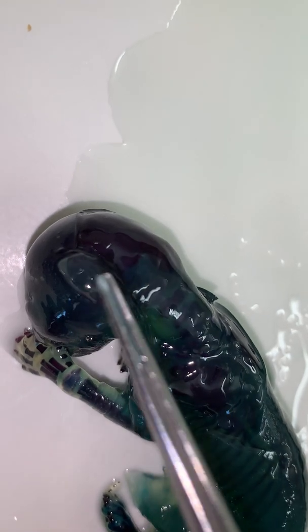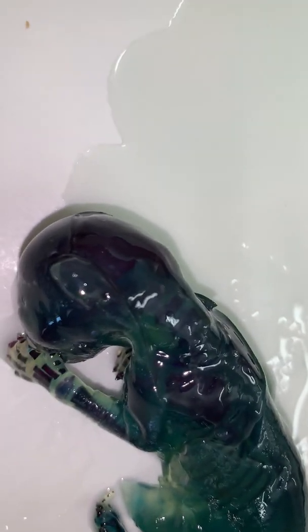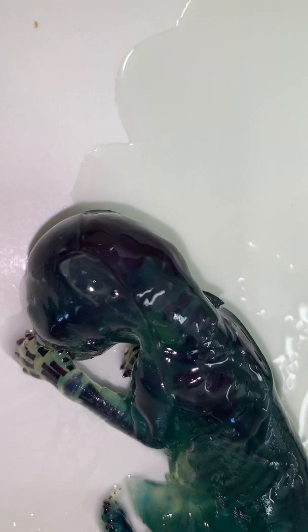Anyway, back end of the skull there. So if we look at the top skull bones, they're actually already contacting one another, but if we look further back here, there is a space here because the back bones, the occipital bones, those are endochondral, whereas these are intramembranous. So the endochondral bones haven't fully changed their cartilage to bone, but the intramembranous bones form fully as a bone. So we see this major difference within that cat itself.